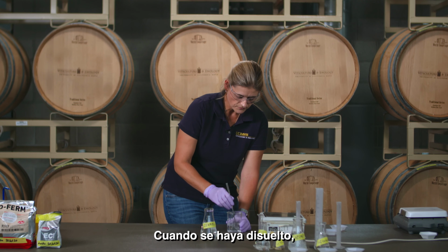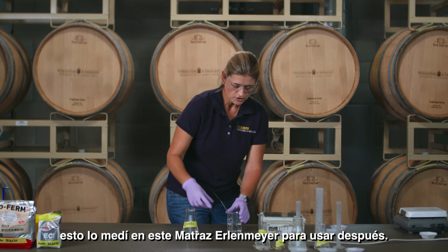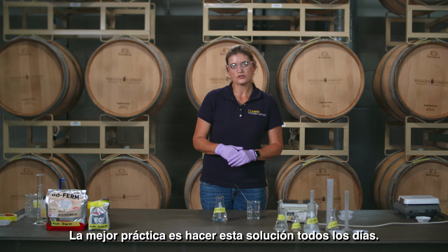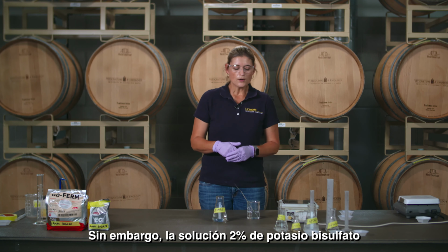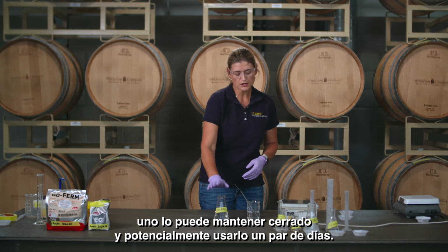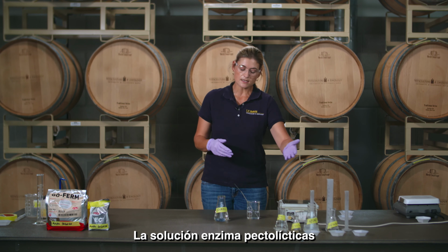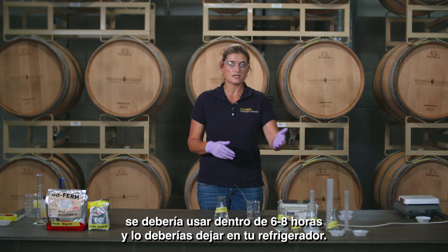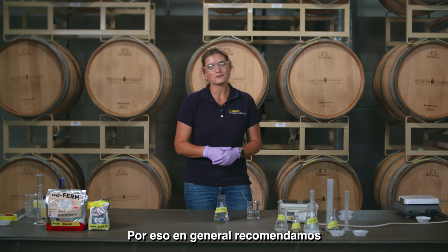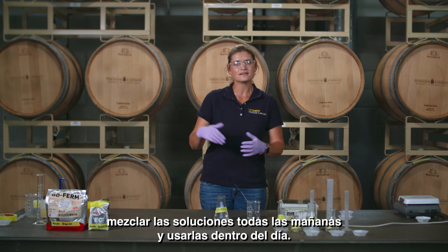And when that has dissolved, I previously poured it into this Erlenmeyer to use later. Best practice would be to make these solutions fresh every day. However, something like 2% potassium metabisulfite, if you keep it closed, you can potentially use it for a few days. Pectolytic enzyme solution, for instance, you want to use within 6 to 8 hours and you want to keep it in your fridge. This is why, in general, we just make the recommendation of make your solutions fresh every morning and use it that day.